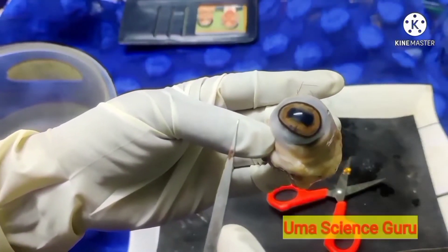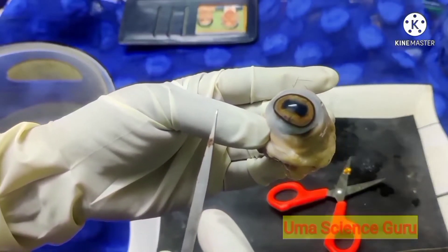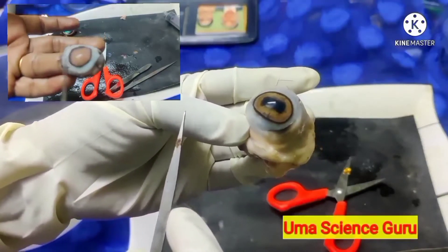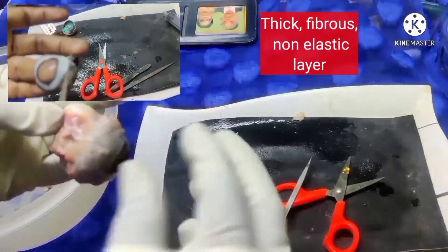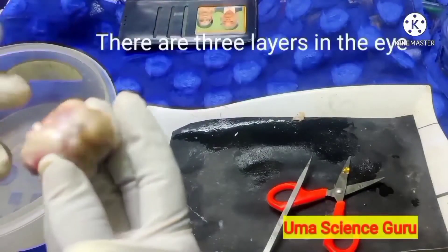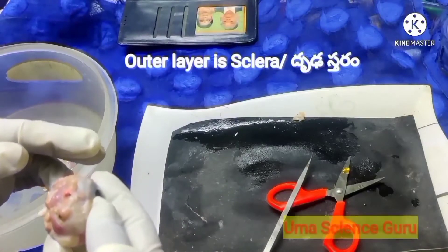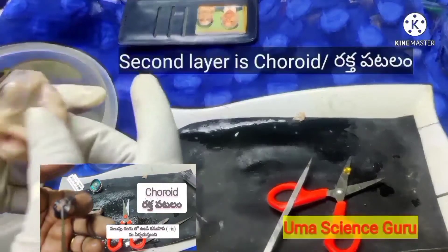In this dissection you can observe each layer and its function. Students, observe the outermost layer — the sclera. It is a thick, tough, fibrous, non-elastic, and white-colored layer. In the front portion of the eye, the sclerotic layer forms the cornea. The second or middle layer is the choroid layer, which has a large number of blood vessels. These blood vessels carry blood to and from the eye.